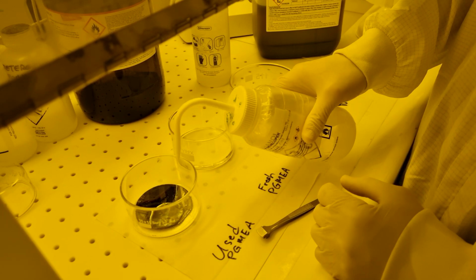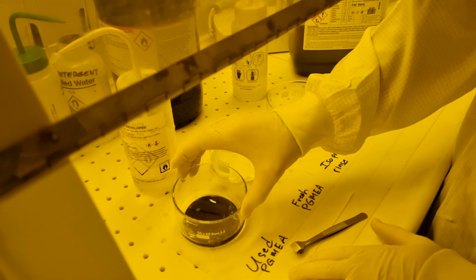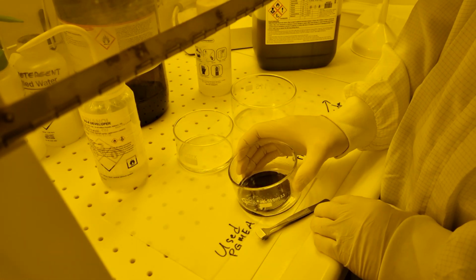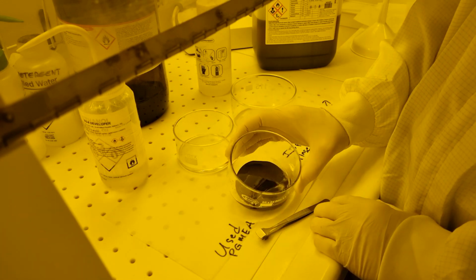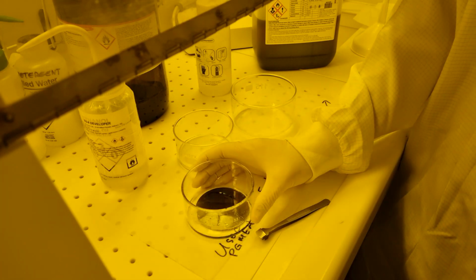Development uses a hazardous solvent called PGMEA that dissolves the non-cross-linked photoresist while having much less effect on the exposed and chemically cross-linked regions. We use 2 baths of PGMEA and 1 dish for rinsing with isopropyl alcohol. Most of the resist removal is done by lightly used solvent from the squirt bottle. Just cover the wafer and agitate by gently rocking back and forth. You can use the spray to help dissolve any thick spots. Keep going until the resist is visibly cleared. This can take a few minutes.